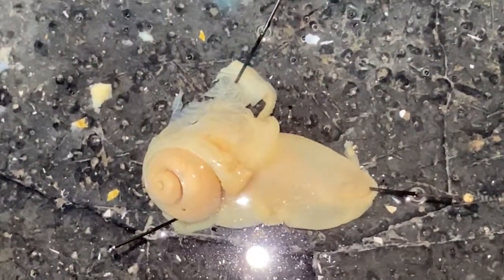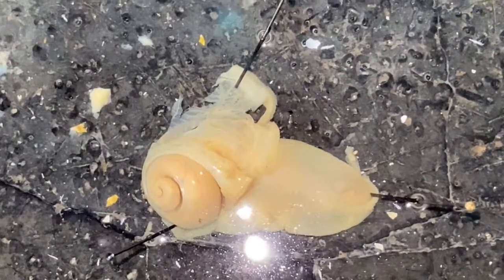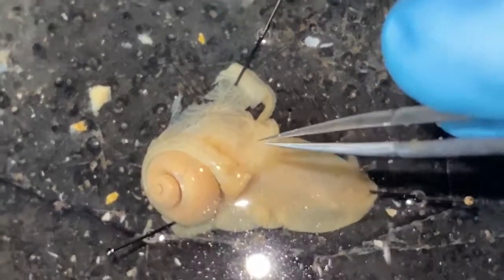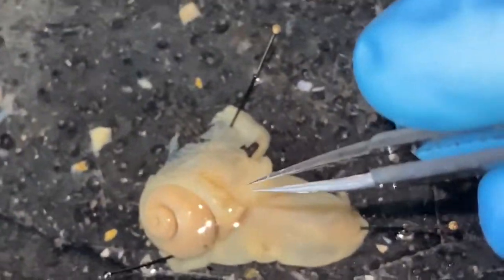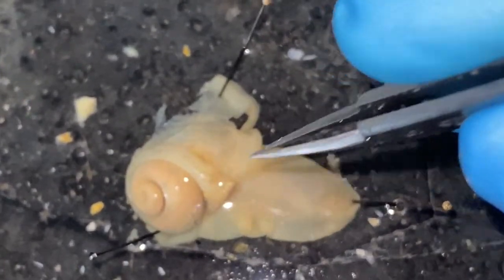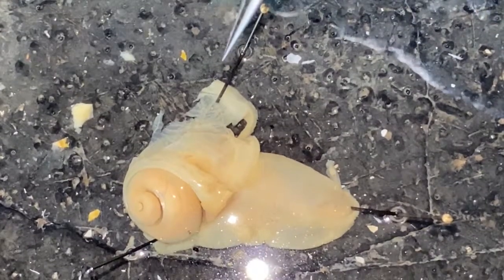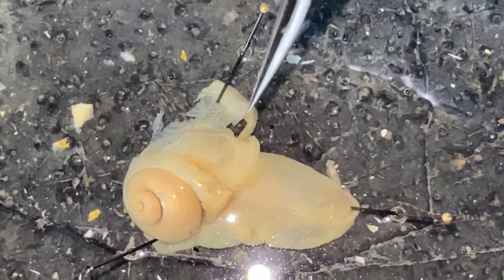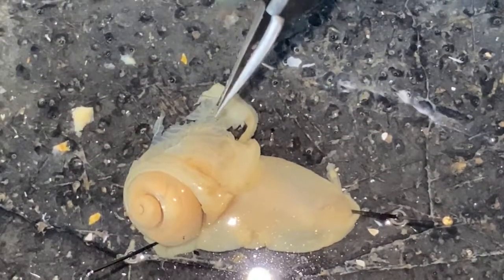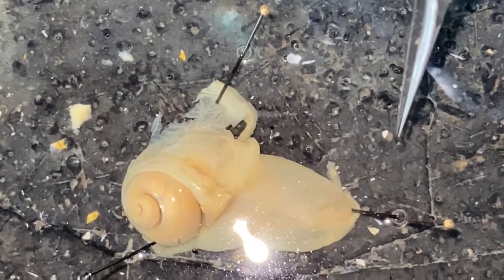What I've done is clipped the edge of the mantle along the connection so that the collar is cut right here and flipped outwards. This is the edge of the collar, and you can see vascularization in the dorsal wall of the mantle cavity.